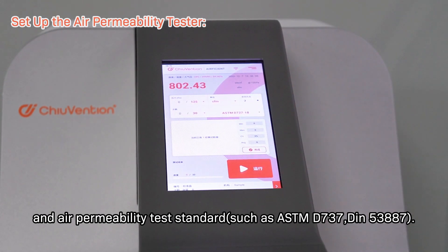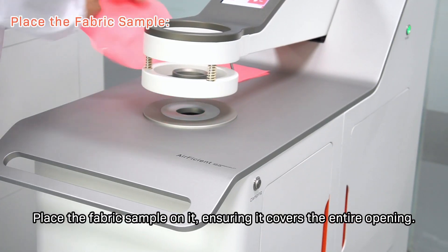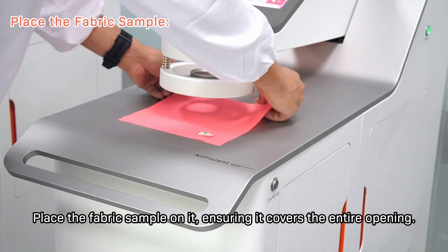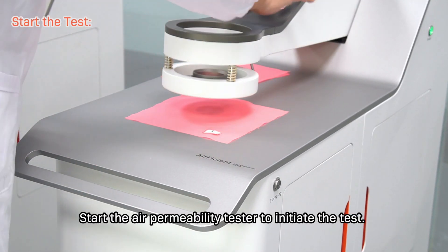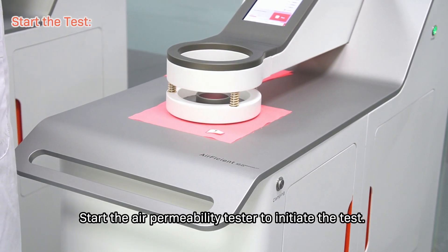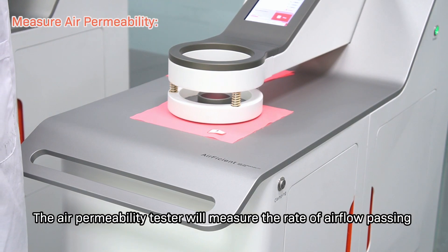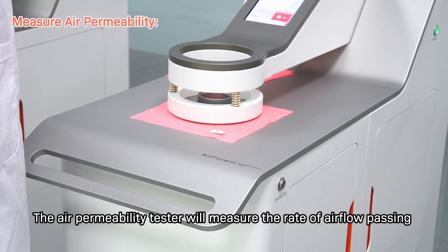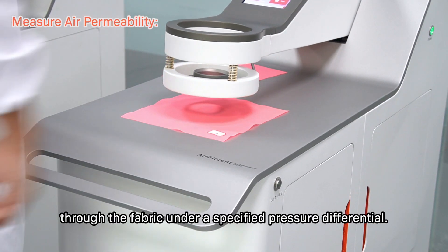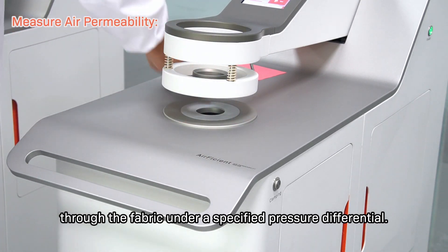or DIN 53887. Place the fabric sample on it, ensuring it covers the entire opening. Start the air permeability tester to initiate the test. The tester will measure the rate of airflow passing through the fabric under a specified pressure differential.